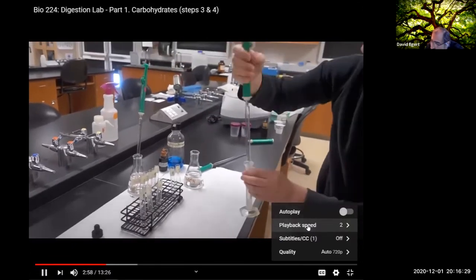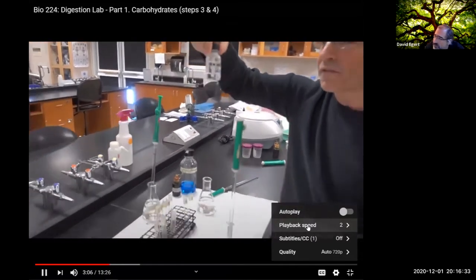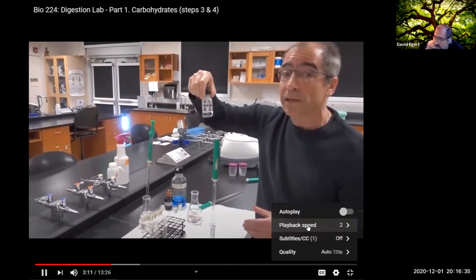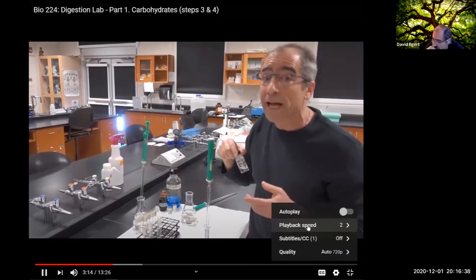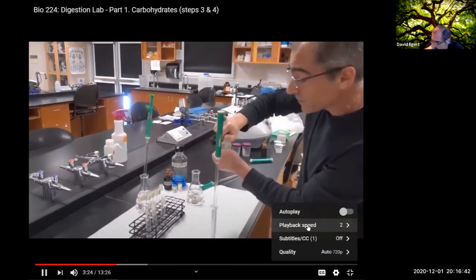For test tube 3, before we add the saliva in, we are going to lower the pH by using this concentrated hydrochloric acid. This stuff is something you got to be careful with. You should not be using this without wearing eye protection. Regular glasses can work. If you don't wear glasses, you got to be wearing goggles of some sort. This can damage your eyes, your skin or your clothes or anything. So be careful with it.